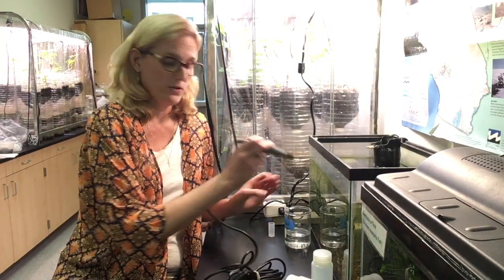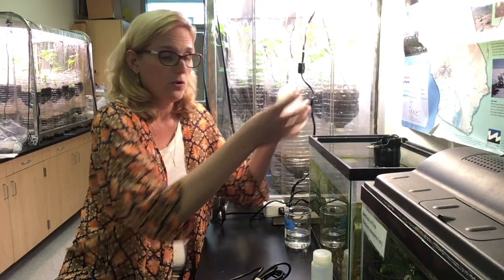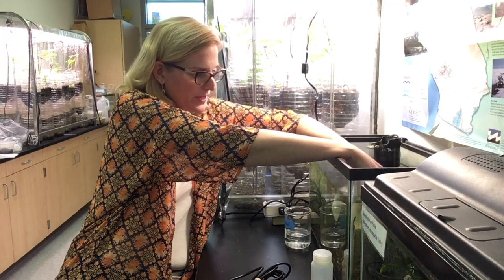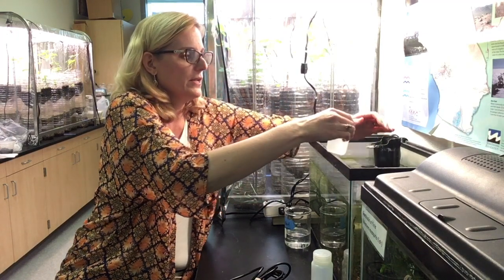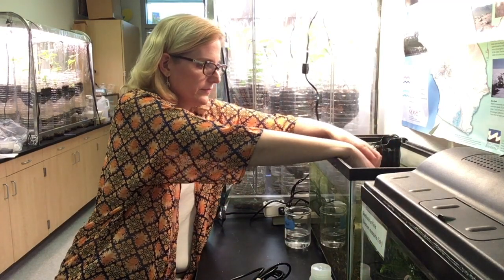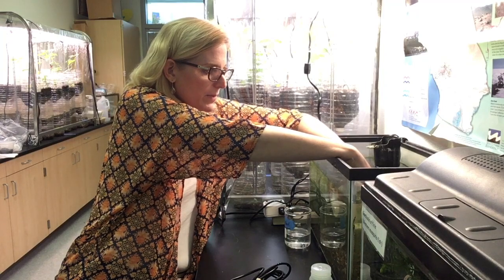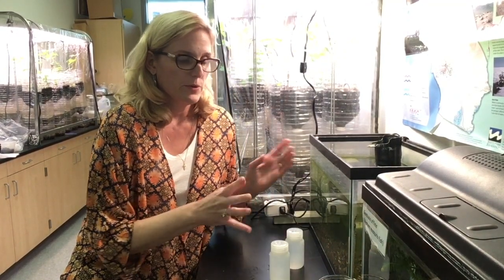I'm going to rinse my probe in distilled water and put the cap back on. Now I'm going to take some bottles and fill them all the way up. I want to make sure there are no air bubbles, so I'm going to cap them underwater. I want to make sure there's no air in here because it will skew the reading later on. I'm going to fill up two bottles with the same water source — you can do this in a pond, a lake, or any body of water.